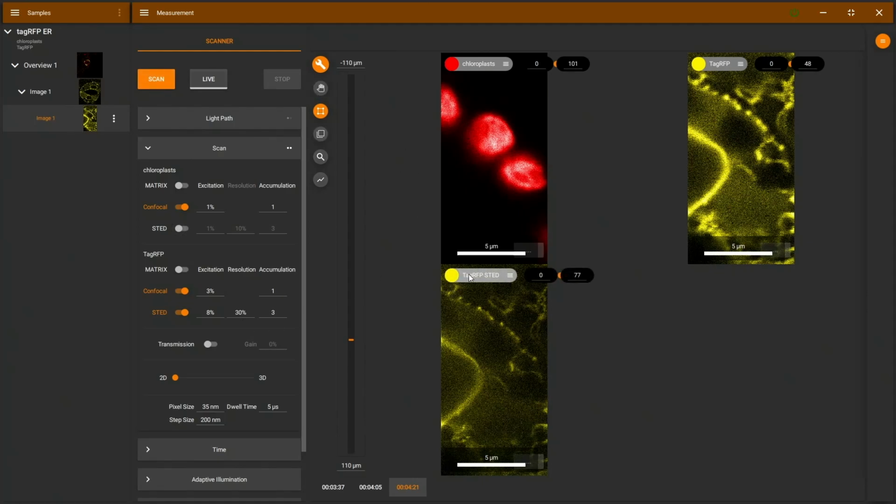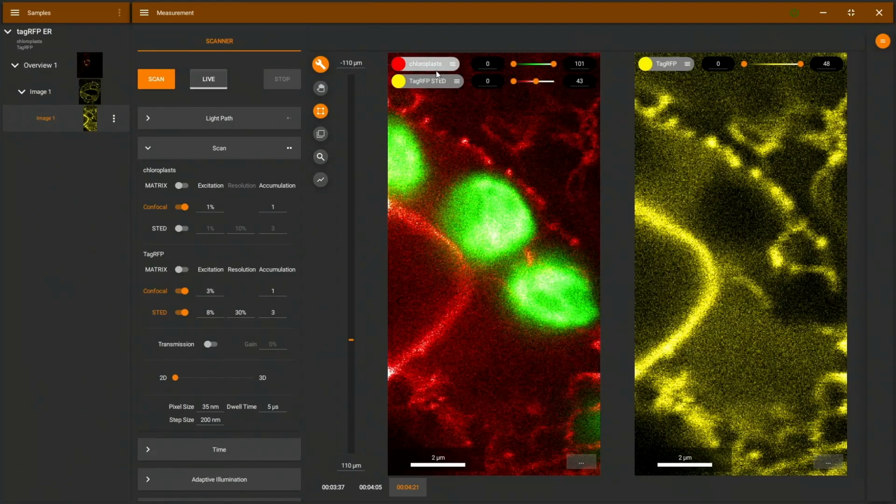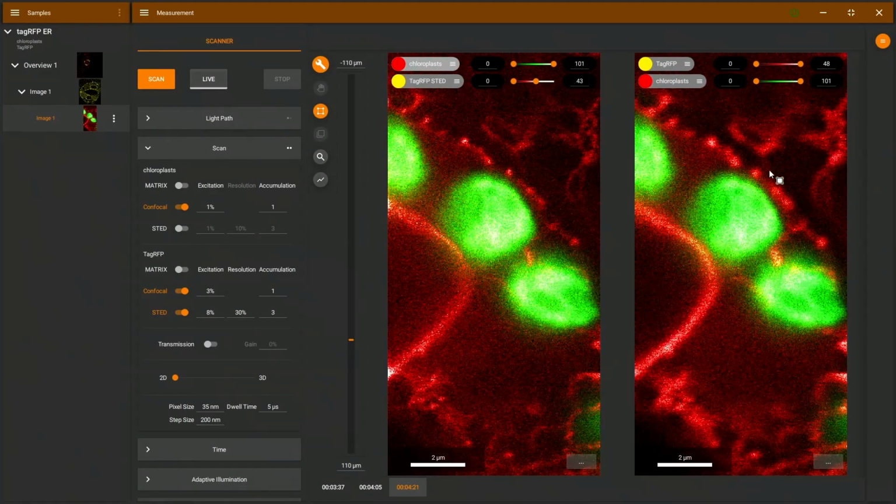And what we can also see is that the chloroplast didn't change shape or disappear or anything. Here we can see on the top right again the structure. I'll duplicate the chloroplast image. Now we have two identical images here. On the right, confocal, on the left, STED.